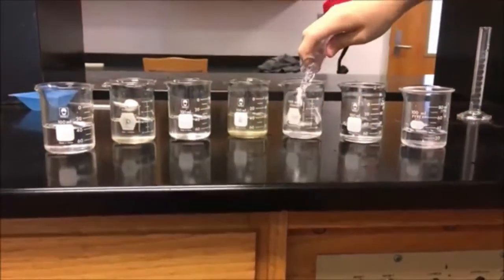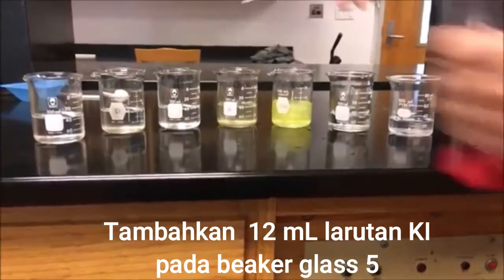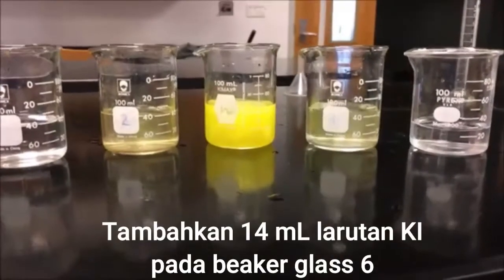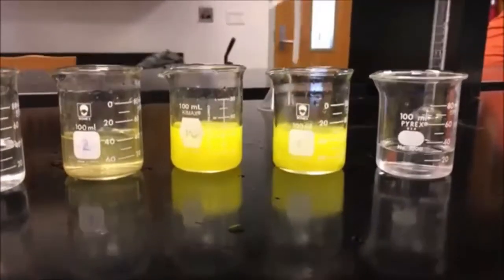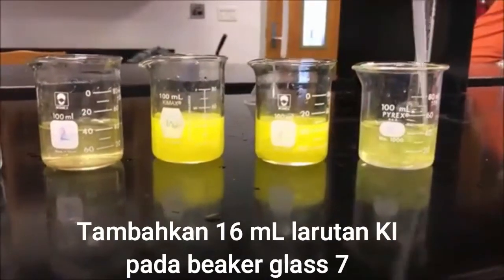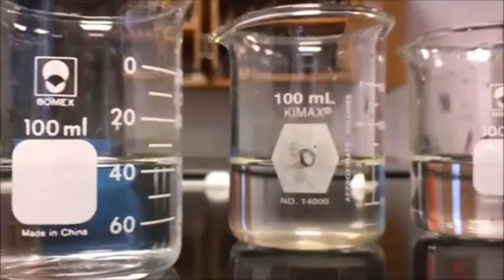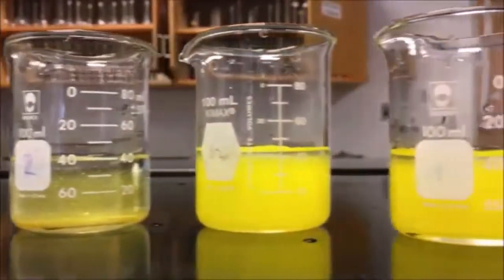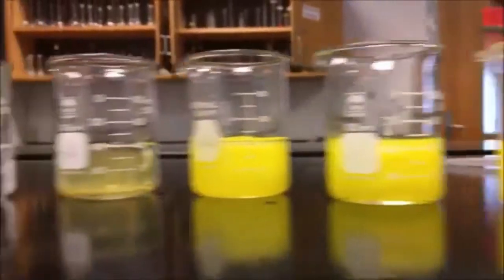Add 13 milliliters to the fifth beaker, and the precipitate becomes obvious. The same thing happens for the sixth and last beaker by adding 14 milliliters and 16 milliliters respectively. Make sure to stir occasionally so the reaction happens faster. By lining up our beakers 1 through 7, we can tell that the fourth beaker is the closest to KSP. It precipitates the least out of the last 4 beakers.